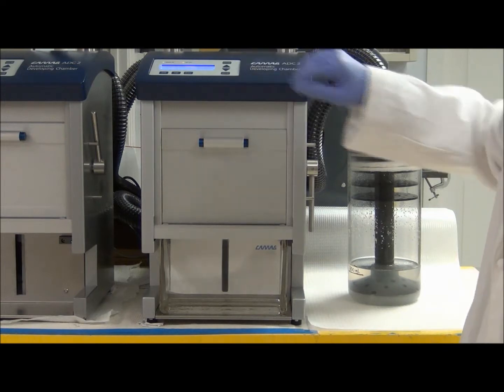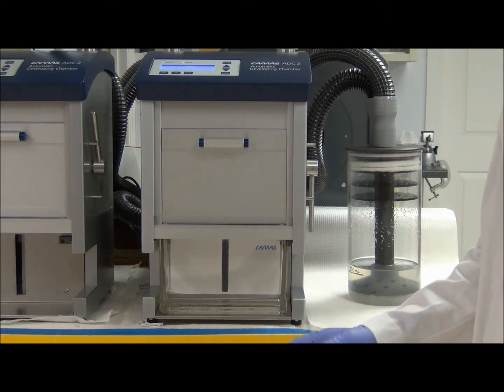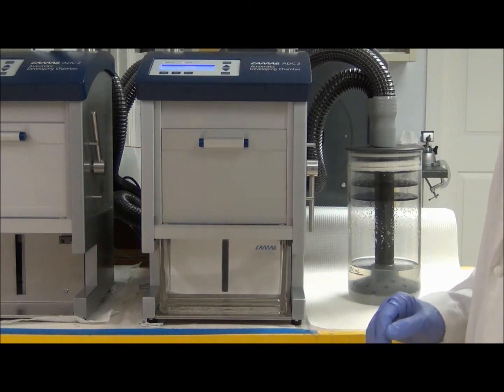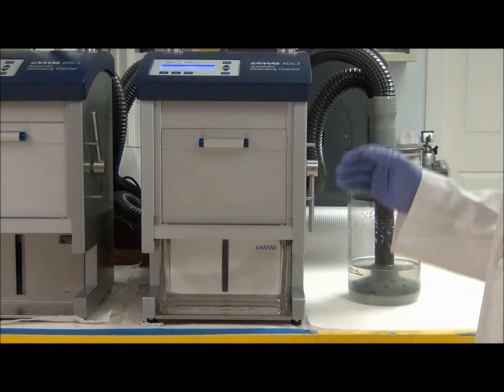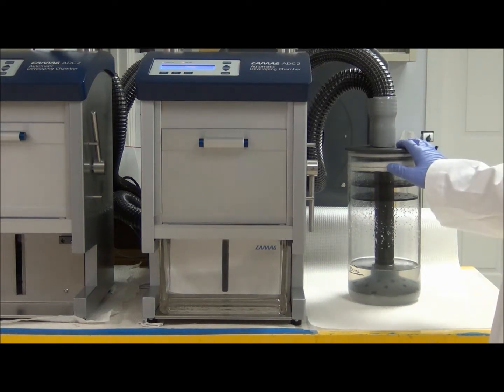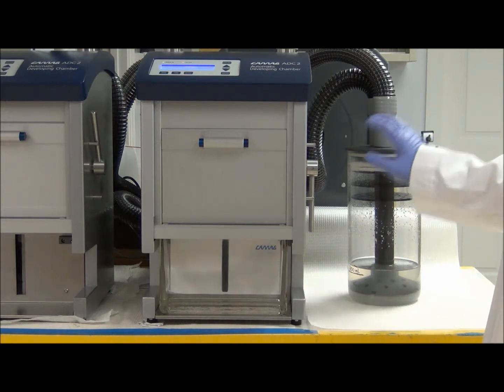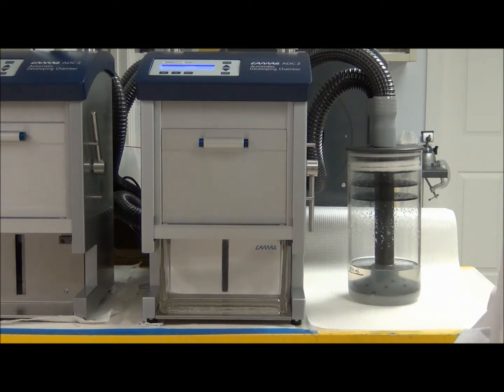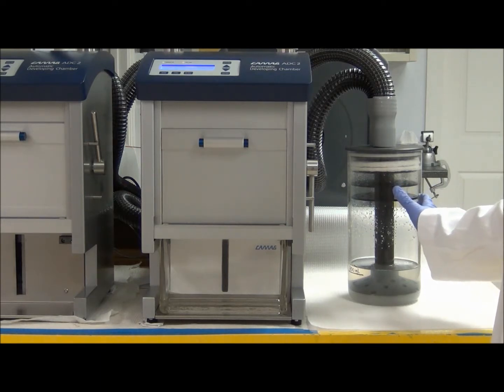On the display it shows the tank saturating and the time counting down, and this is also shown in the software. Right now we're at 20 minutes — all of our methods call for 20 minutes of chamber saturation. At the 10-minute mark into that 20-minute process, the humidity control process will begin, so for the final 10 minutes it will be both saturation and humidity control. That's the typical settings we use: 20 minutes for chamber saturation with the final 10 minutes also including humidity control.